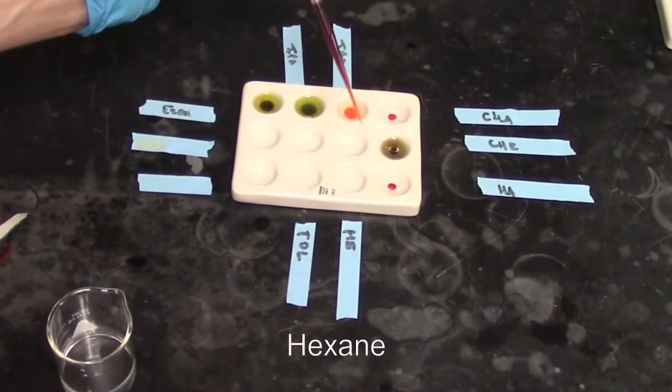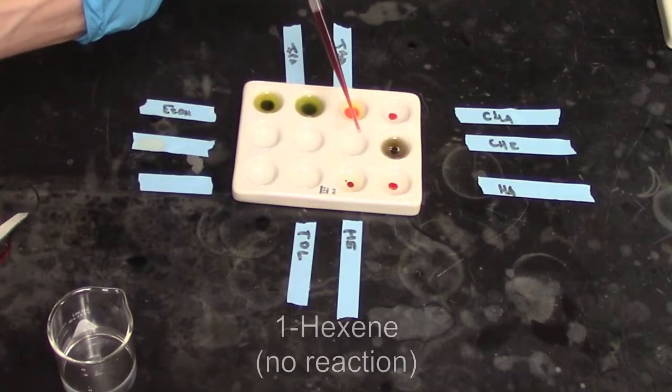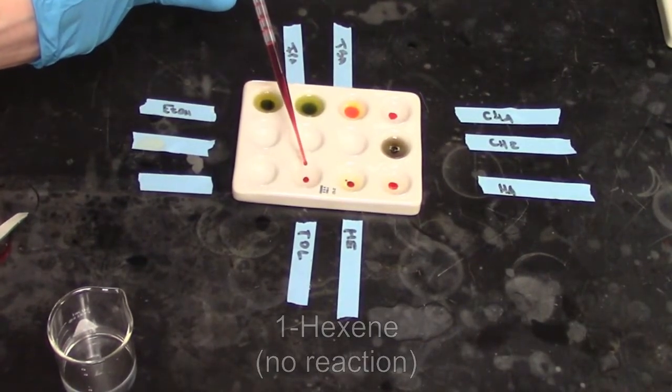Hexane, hexene, not much of a reaction there, and then the toluene.